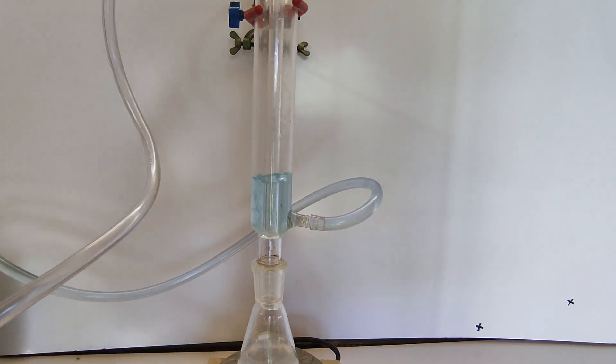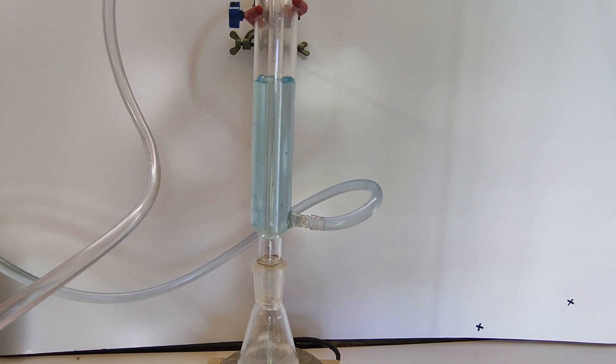After all of the sodium borohydride has been added, the reaction is refluxed for one hour.